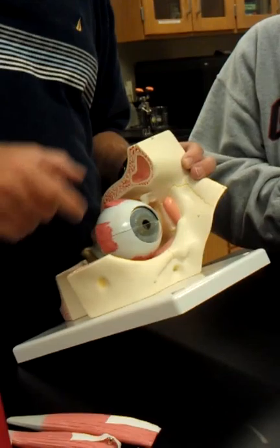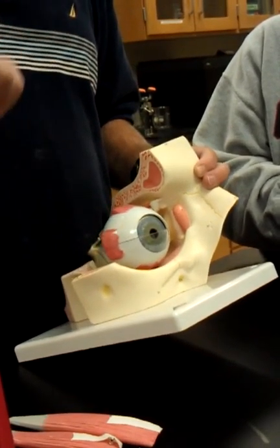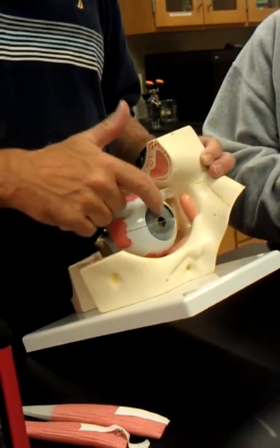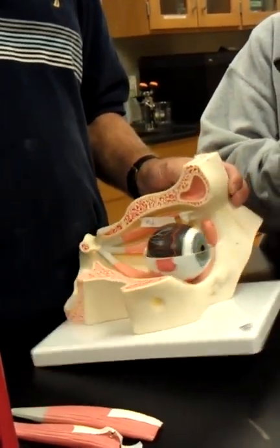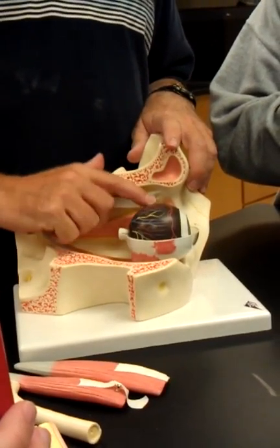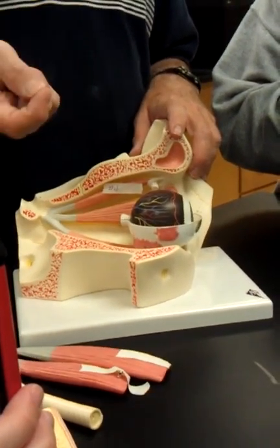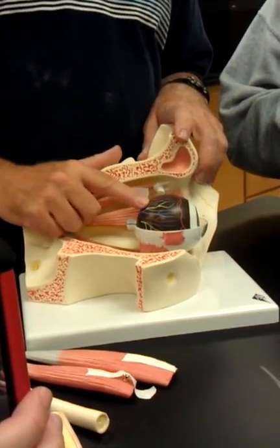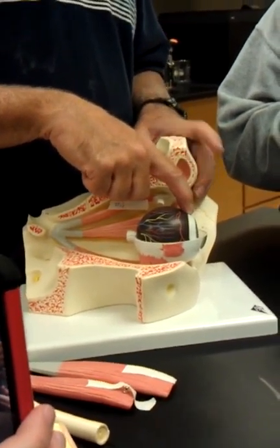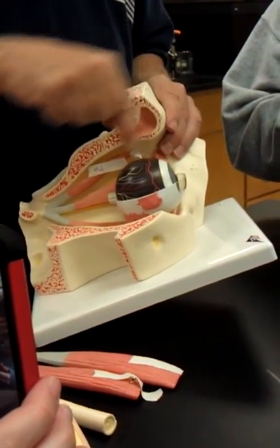But anyway, this would be the iris, and the hole in the iris that looks black when you look at a person's eye would be the pupil. So these are parts of the middle tunic, or the uvea, that you can see. Because the outer tunic is the sclera and the cornea, and they're just continuous. The pigmented iris gives color to a person's eye, and the hole in the middle of the iris, it honestly isn't anything, it's just a hole, that would be the pupil. All right, let's take this off. Now we're seeing the middle part of the eye. So this brown, highly vascularized part of the middle tunic, which is the uvea, is the choroid. And the choroid then leads to the white-colored ciliary body. And off the ciliary body would be the iris, and the hole in the iris is the pupil.